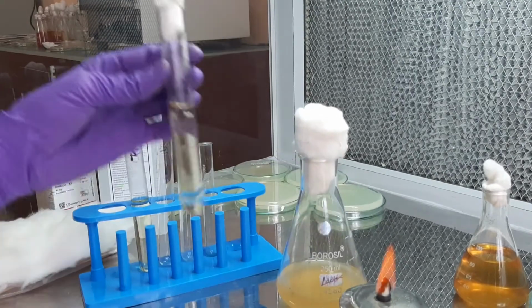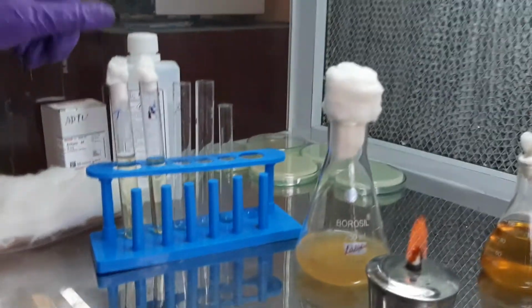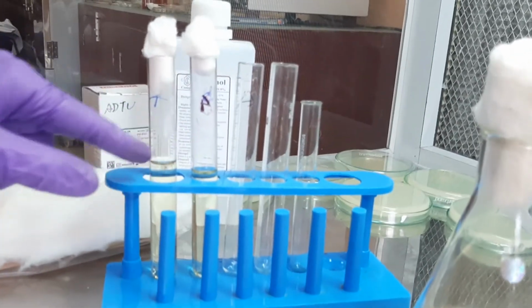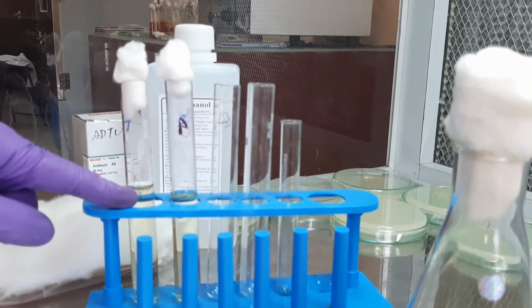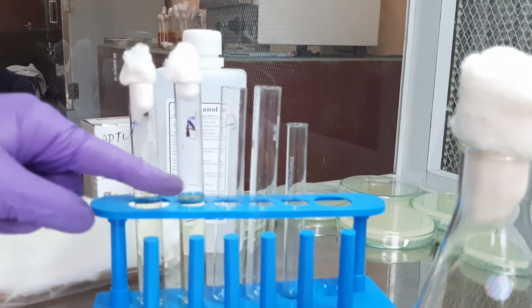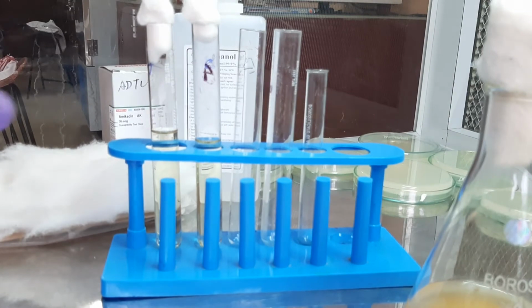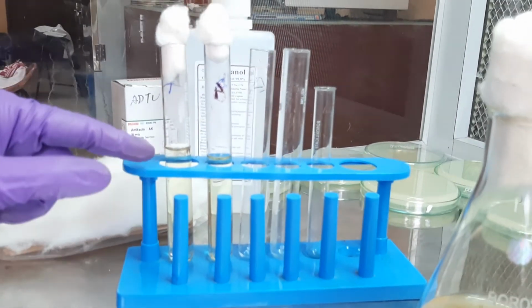And now inoculation is done, and we will have to incubate both test and control tubes in the incubator for 24 hours at 37 degrees centigrade. Tomorrow, after incubation is over, we will be adding Kovacs reagent to both the tubes. If there is indole, then the Kovacs reagent reacts with the indole and forms a cherry red ring on top of it. If it does not produce indole, then there will be no cherry red ring formation. So, production of indole is indicative of the presence of the tryptophanase enzyme, which has broken down the tryptophan into indole. That is what we will be looking for after incubation.